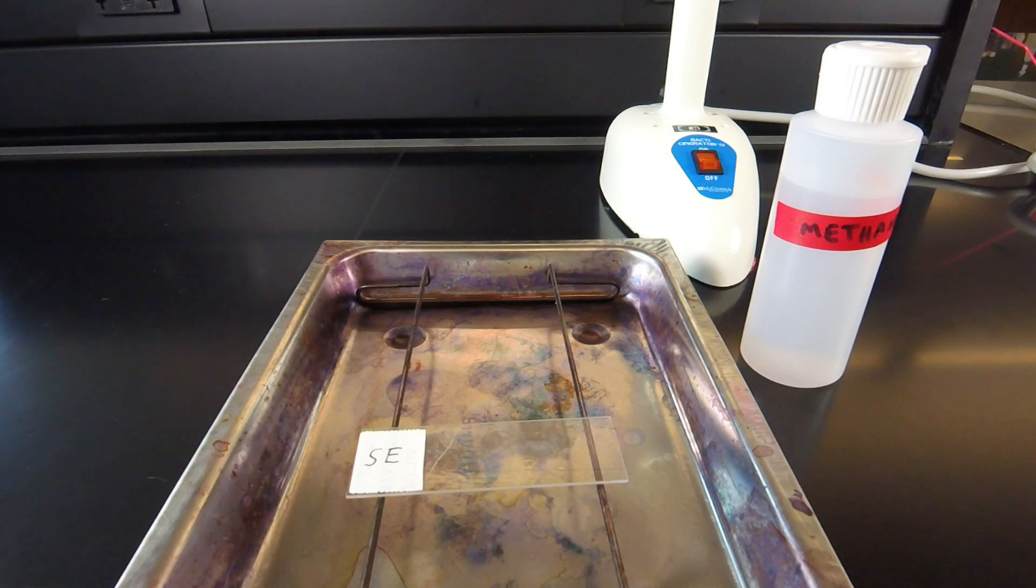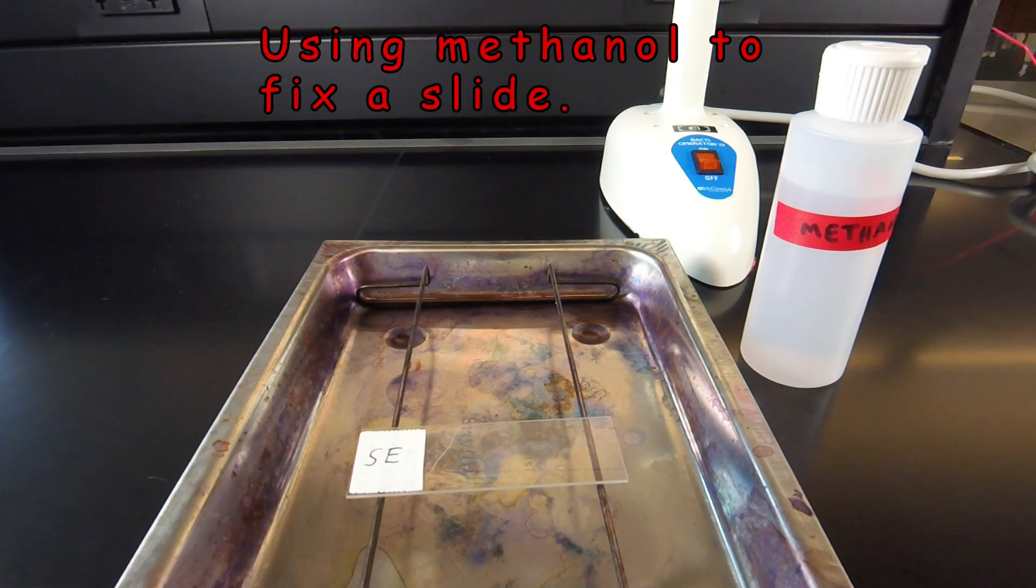In this video lesson, we're going to learn how to chemically fix bacteria to a microscope slide using methanol.